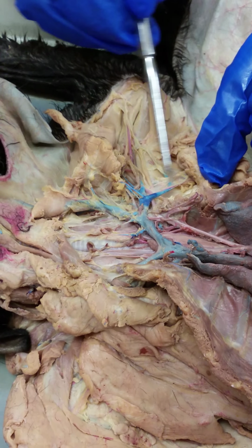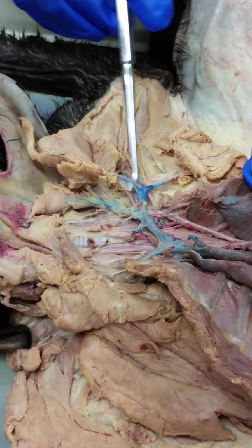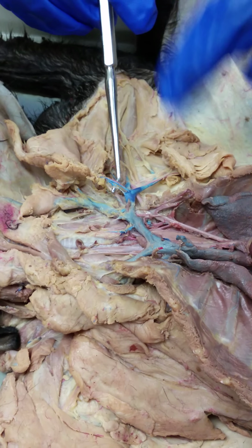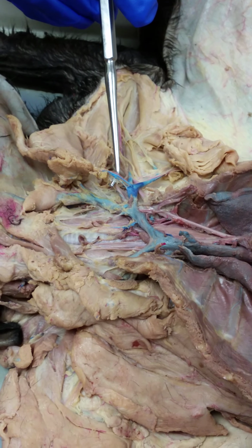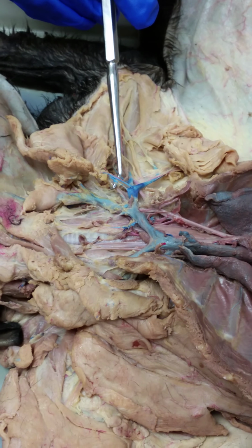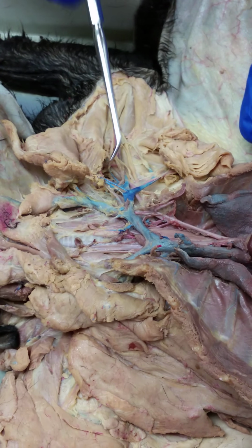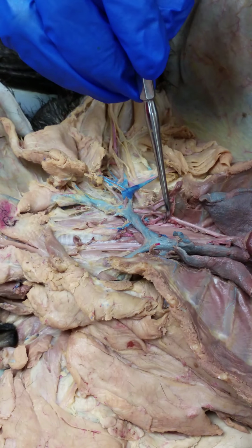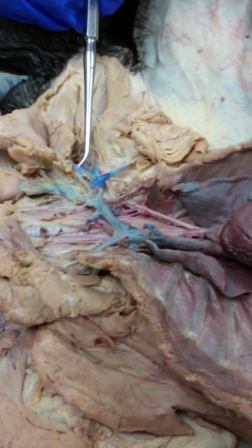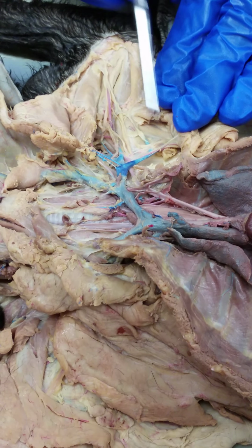Right before the long thoracic branches down, you've got the ones branching here, and that is the ventral thoracic. So it's the only other artery, and it's actually paired with this ventral thoracic vein right here, the blue one. It's the only other one besides the internal mammary here that's coming ventrally. Okay, that's pointed ventrally as opposed to like anterior, posterior, or down. Okay, so we have vertebral, costocervical, thyrocervical, then it turns into axillary. You've got this ventral thoracic branch up. You have a long thoracic artery branch down.